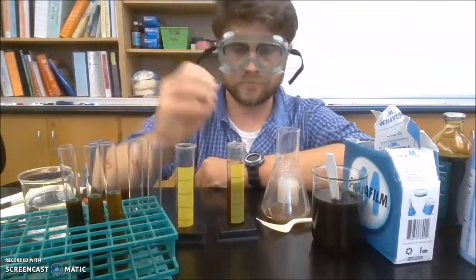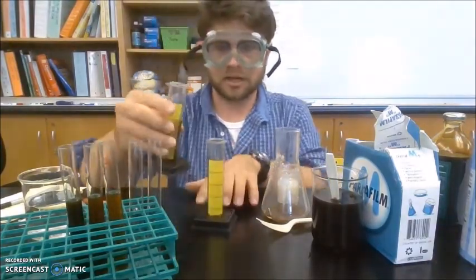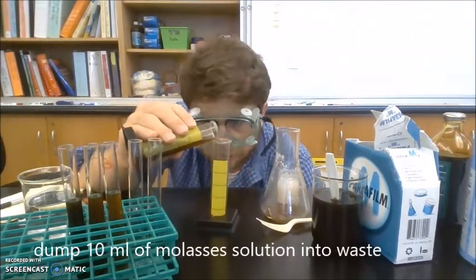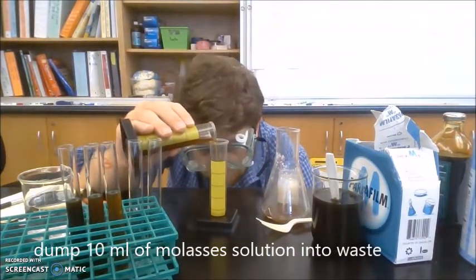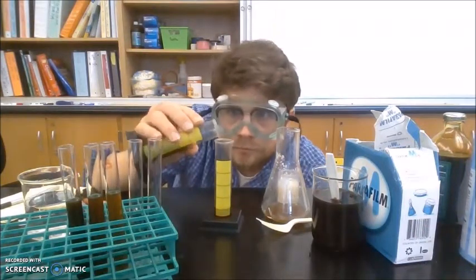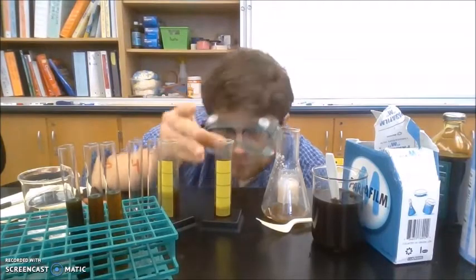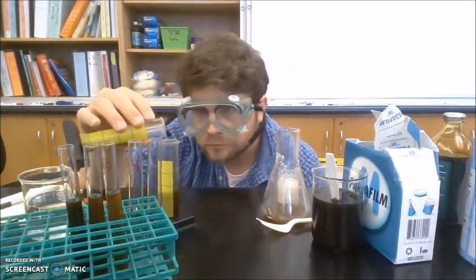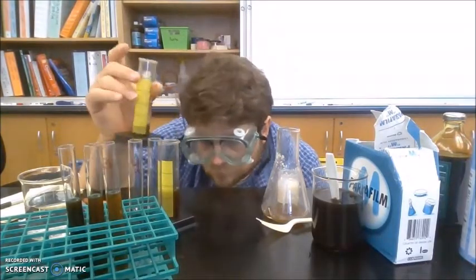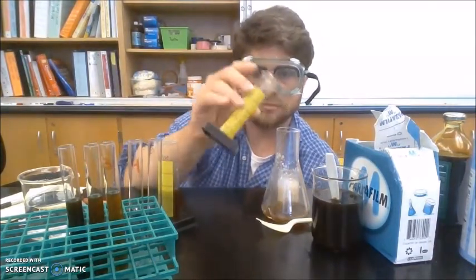There we go. So I'm going to dump 10 milliliters out of my stock solution. Okay, so dump this in my waste.